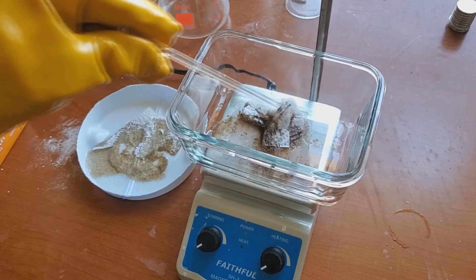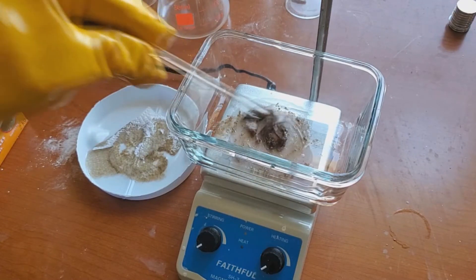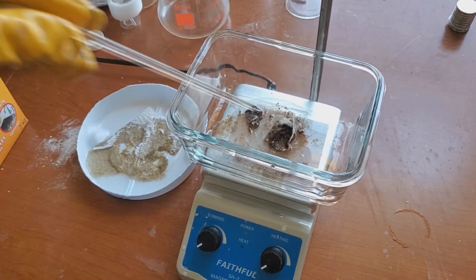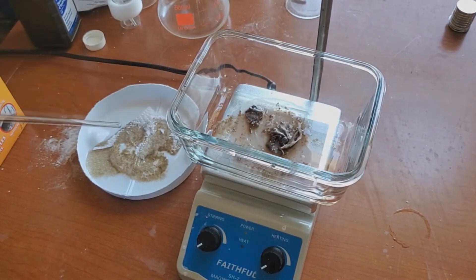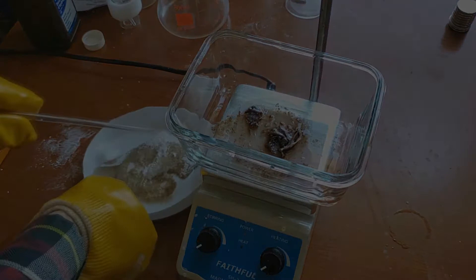A quick little note: anything above 50% hydrogen peroxide to concentrate it is not a good idea to mix to make piranha solution. The solution becomes highly explosive.